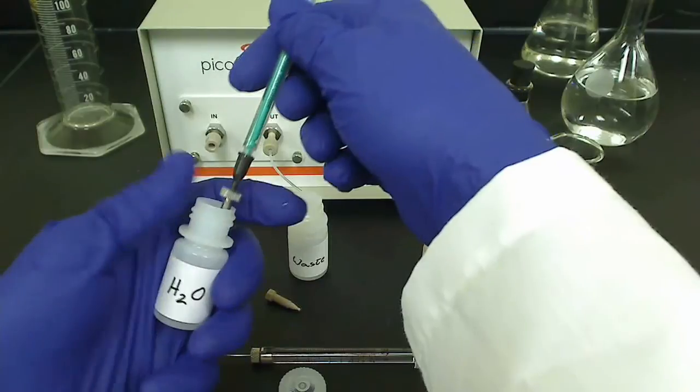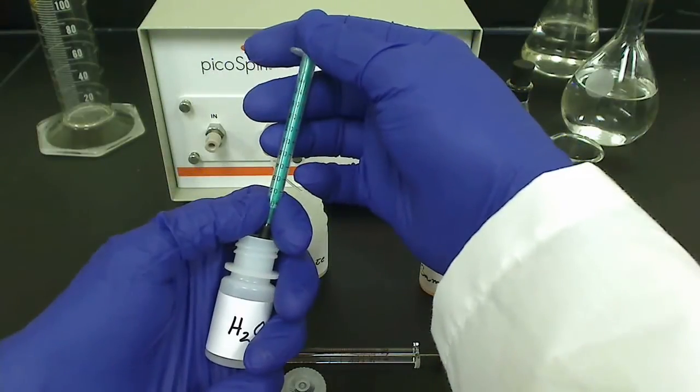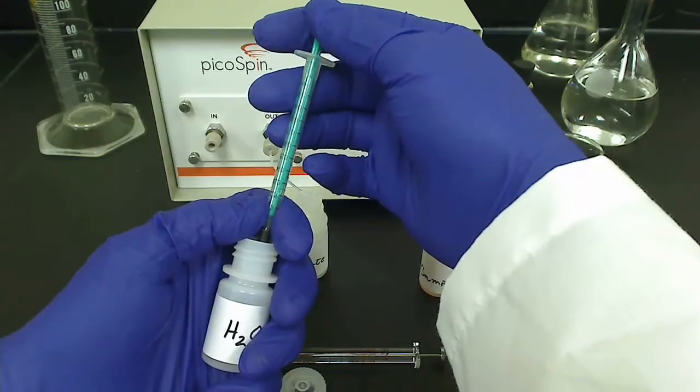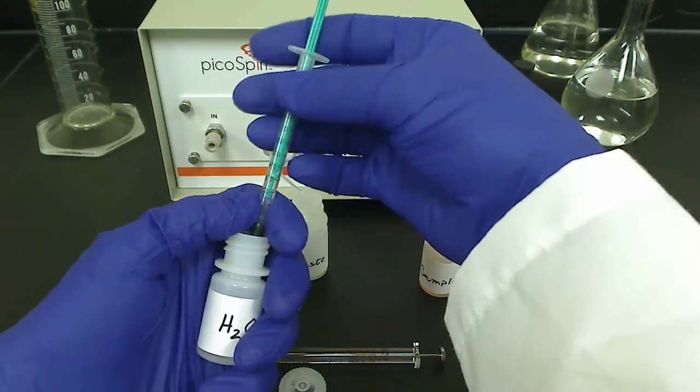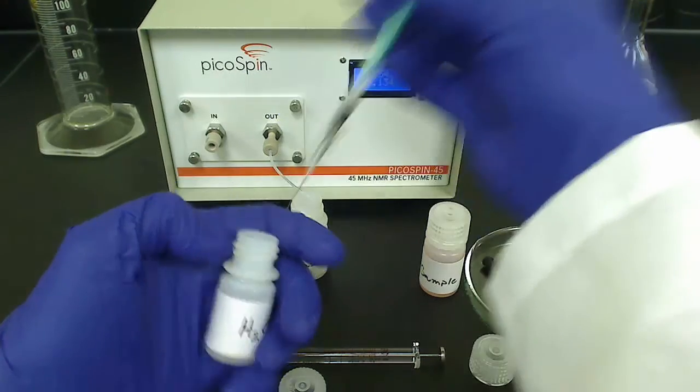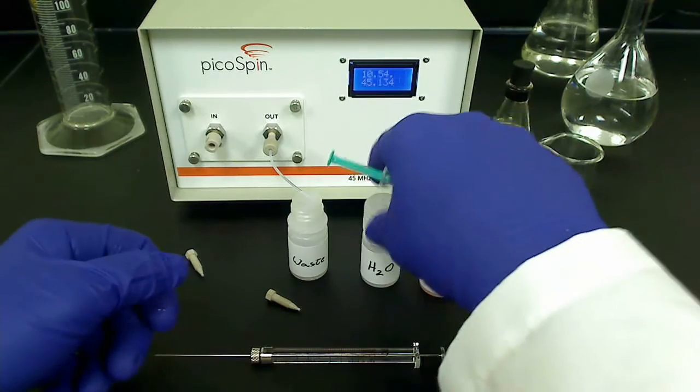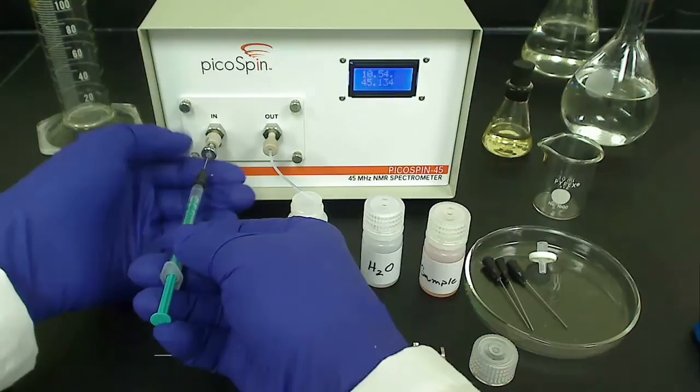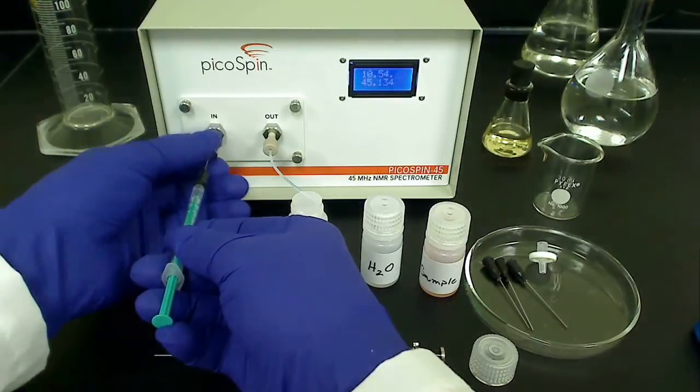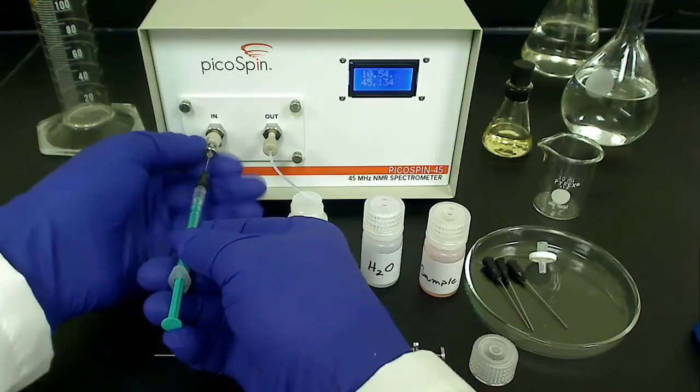Keep in mind you're injecting a sample from a relatively large bore syringe barrel into a small bore 22 gauge needle, and that trying to inject too quickly can build up pressure at the syringe needle connection, thus rupturing the connection. When injecting, steadily apply light pressure to the plunger. If it seems too much pressure is being applied, then perhaps a constriction is present somewhere along the sample flow path, or the sample is viscous and liquid flow is slow. This is best monitored at the exit of the drain tube.